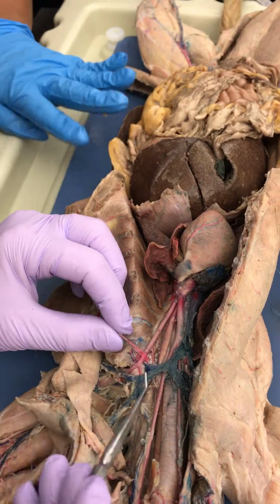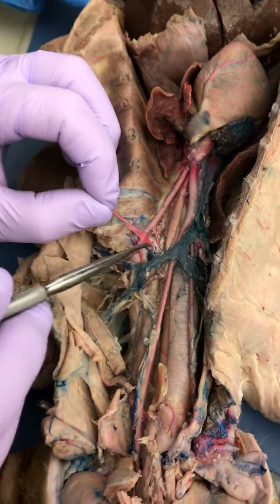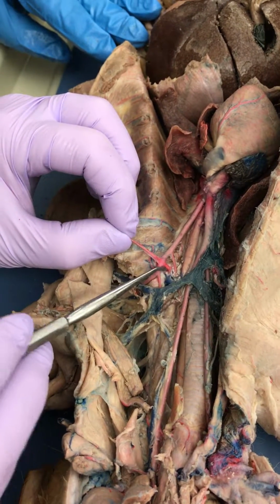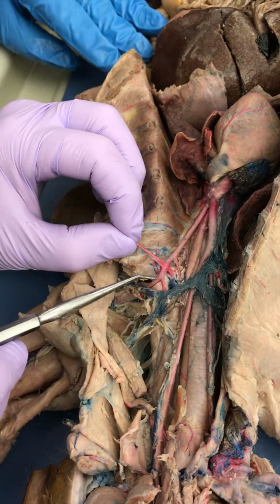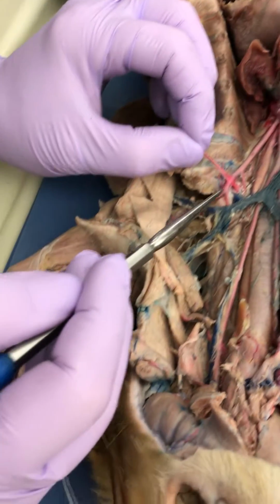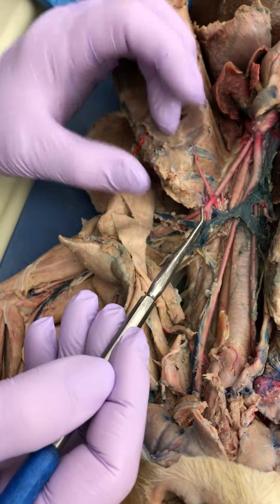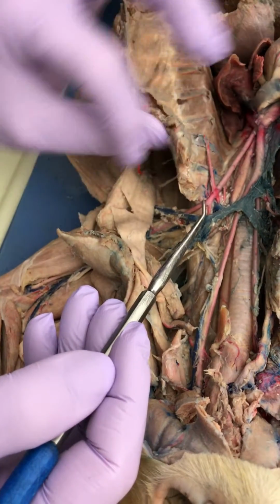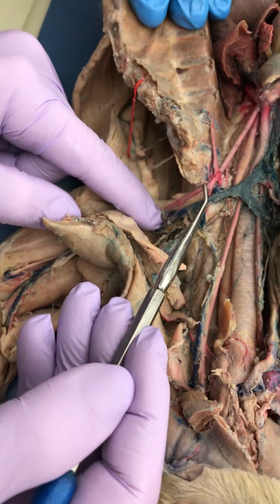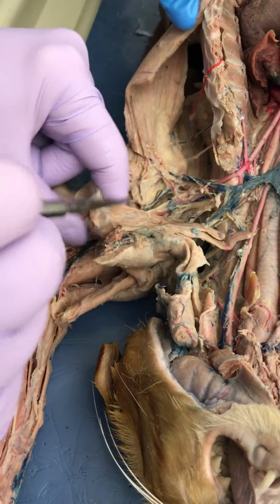Okay, over here we have the left subclavian. And then this is your internal mammary, and I'm going to pull on it. And then we see your VCT: vertebral, costocervical, thyrocervical. And then pretty much as soon as you can see the rib cage here, that really is the end of the subclavian and the beginning of the axillary, because now I'm in my cat's armpit.